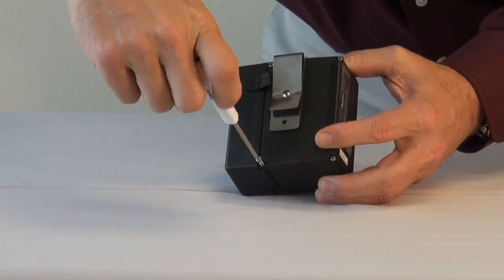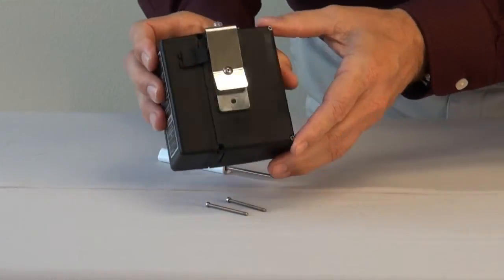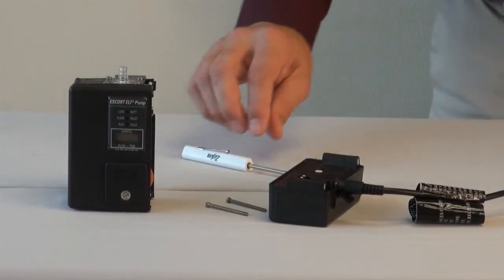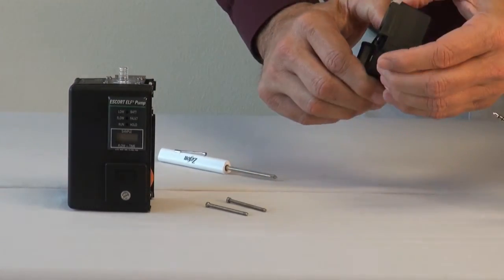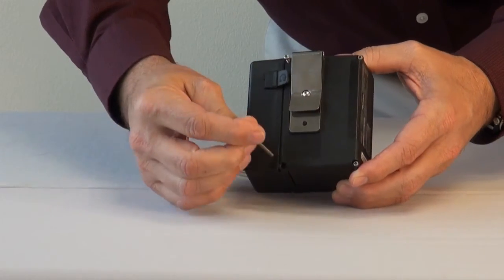To remove the battery and attach a fully charged battery, simply remove the two screws holding the battery to the pump, then pull the battery away from the body of the pump. Disconnect the fully charged battery from the Omega charger, then align and press together the charged battery to the body of the pump. Finally, insert and tighten the two screws.